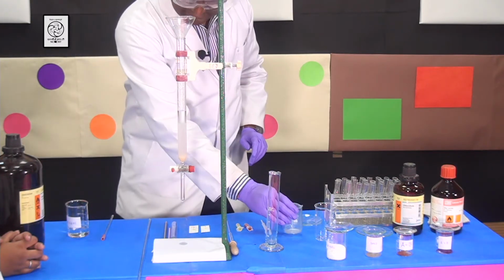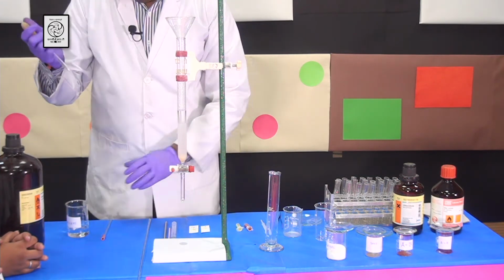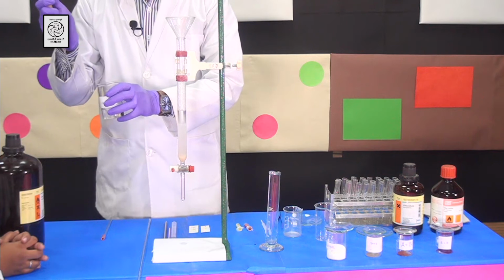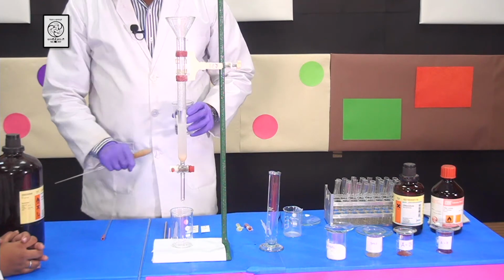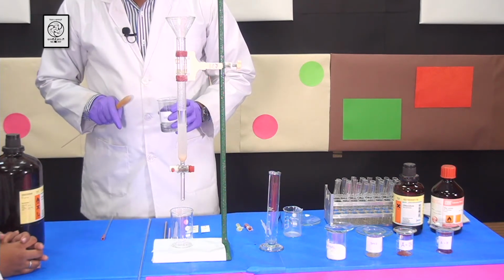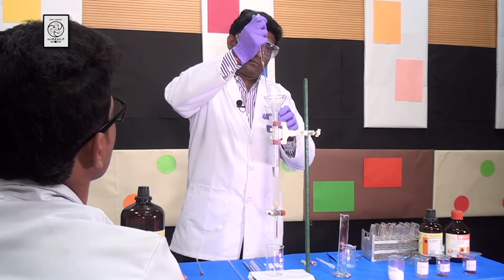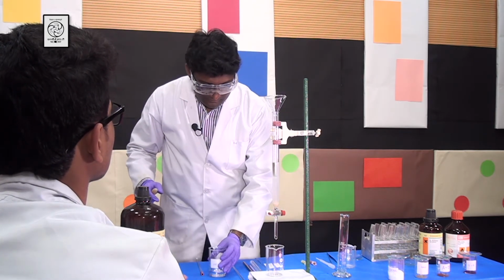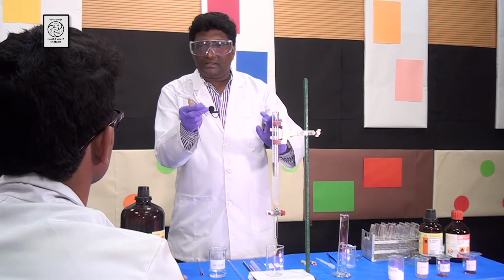Now I am putting this beaker aside. Now I am taking a glass pipette and I am going to wash the sides of the funnel and the column using the hexanes that I am going to use. But before that, I will put a beaker at the bottom so that the solvent doesn't fall on the floor. Okay? Yes, sir. So I am washing the sides of the funnel so nicely. Now I am taking out the glass funnel because totally the silica gel and the glass funnel is washed out.